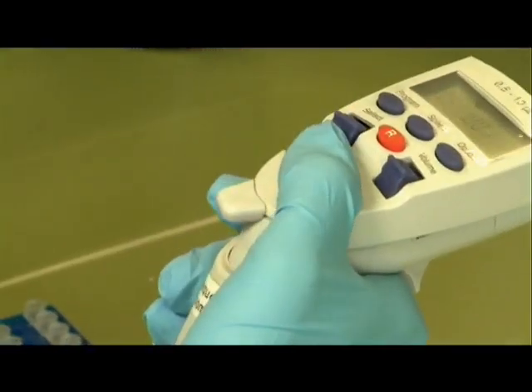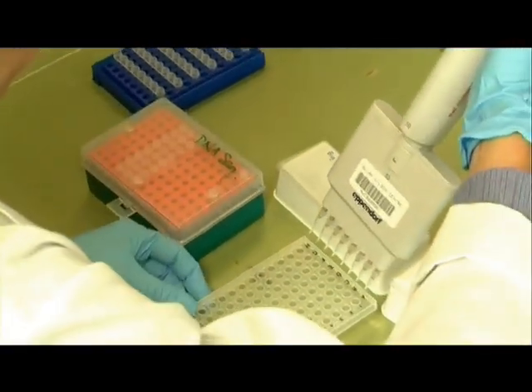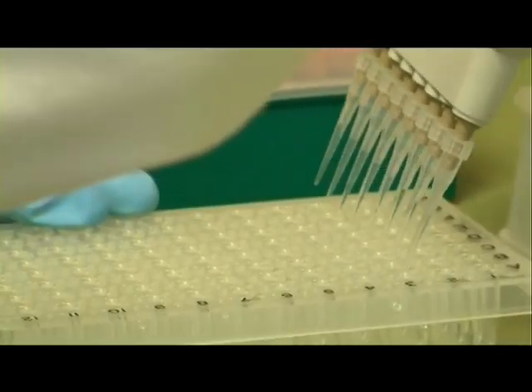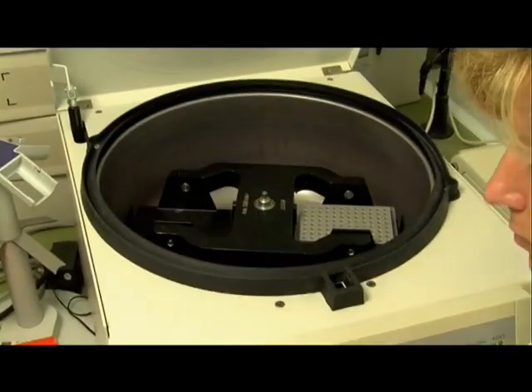Many aspects of molecular biology require you to determine the nucleotide order of your DNA product. One way to do this is Sanger sequencing, which was developed by Frederick Sanger back in 1977, and is still used extensively today. We need to determine the sequence of our weka PCR product in order to determine which subspecies it is. Importantly, PCR products are mixed with just one PCR primer for sequencing. A sequencing reaction mix contains DNA polymerase, nucleotides, and fluorescent nucleotide terminators, and it's added to each of the samples.